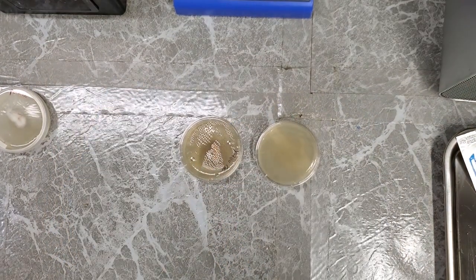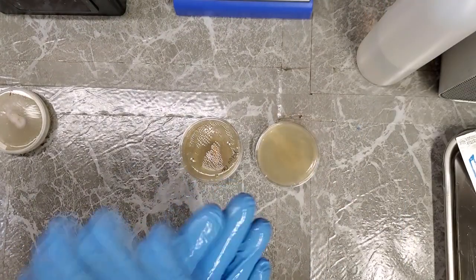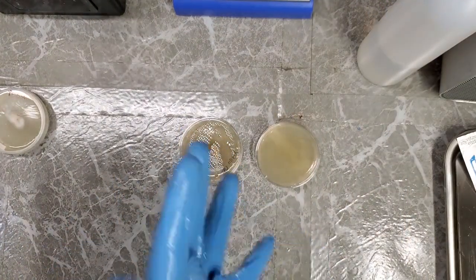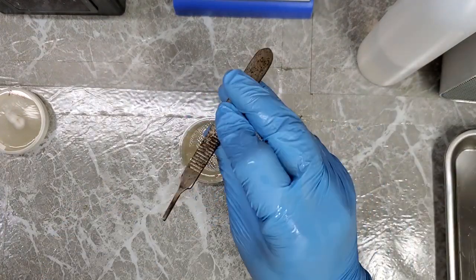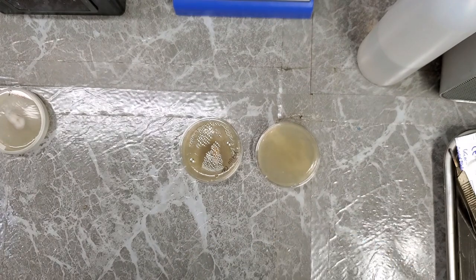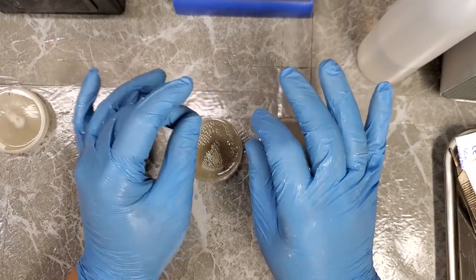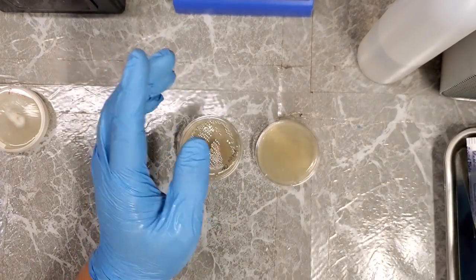I'm going to do this completely out in the open. I'll still make sure that my hands are sanitized and all that stuff. I'm going to be using a sterile scalpel blade, a brand new scalpel blade. This was sprayed down with alcohol. For this demonstration right here, I'm just going to very deliberately show you what I'm doing. So, like I said, if I lose this one too, it's not that big of a deal.